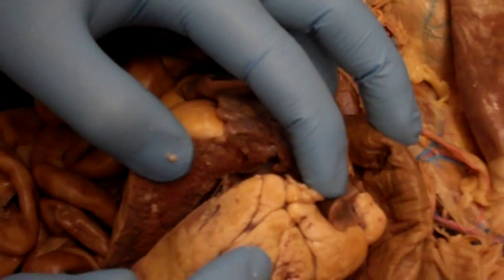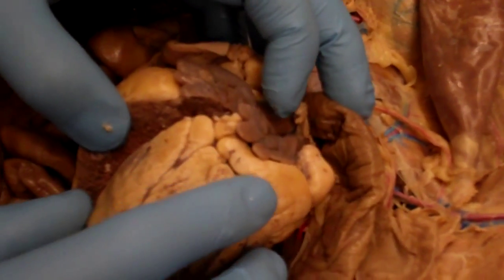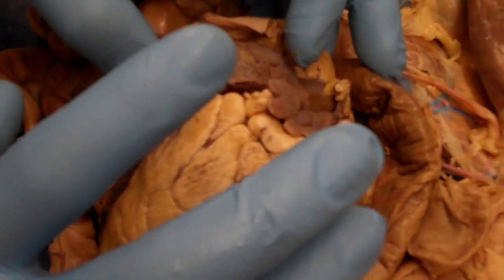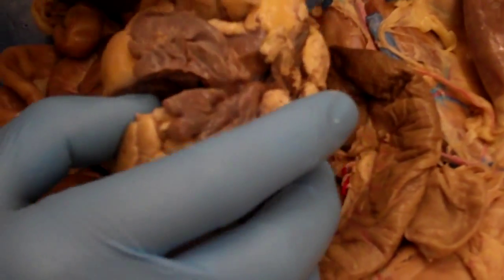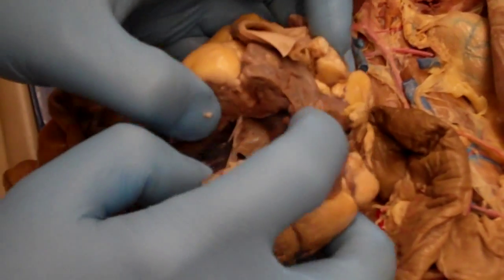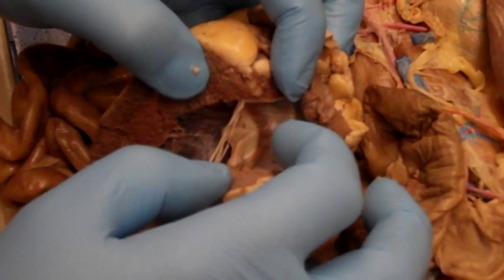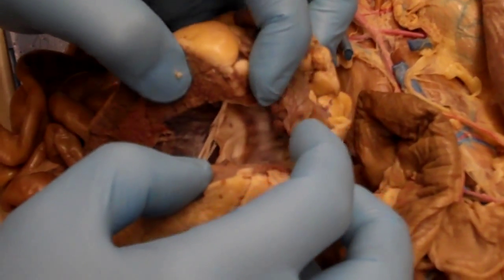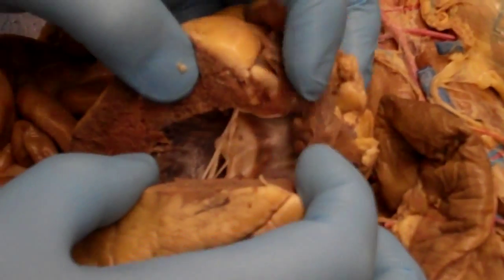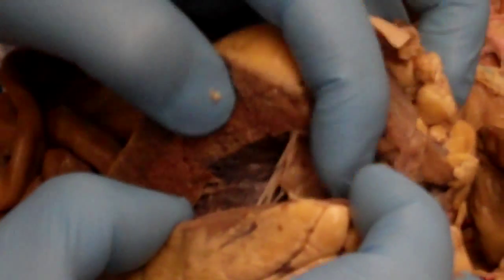So the atria is a smooth sac? Atria is always going to be smooth, yeah, whereas the ventricles are going to be relatively rough. It's sort of a sac. I mean, there's some muscle in there, but it's hard to see it from the outside because there's so many other structures packed in here. When you open it up, it's very easy to tell where the atria is and where the ventricle is. Is it going to be a shiny white type color? Yeah, it should be lighter in color. It should be smooth. Both of them are going to be a little shiny, but I think the atria are maybe a little shinier. Definitely lighter for sure.